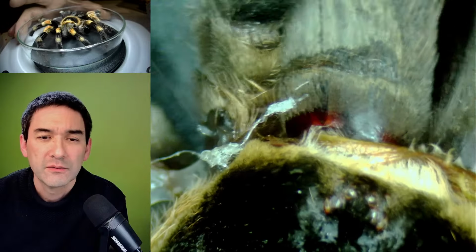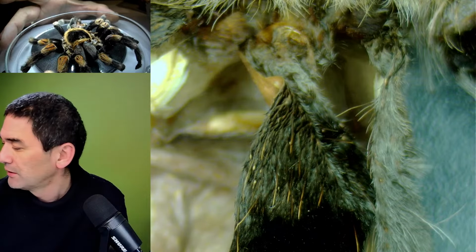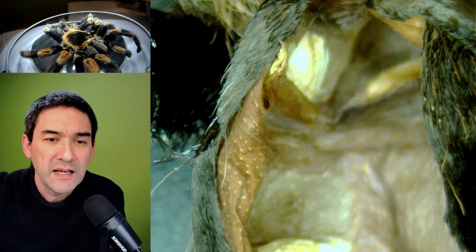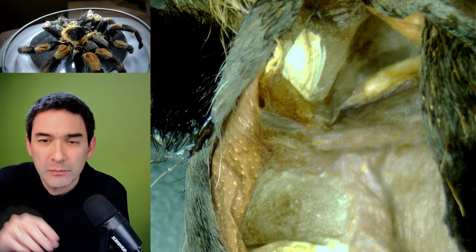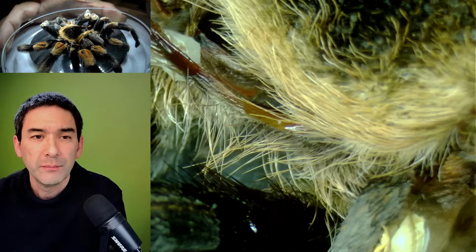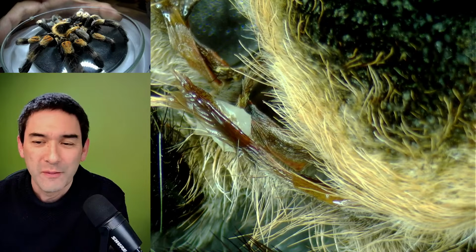Just considering that many of these here actually probably are also sense organs of the spider. Here now on the back, we can actually see this is where it's open, and maybe this is where it emerged, on the back part. The exoskeleton is kind of open, and I suppose that this is where the spider came out when it molted. Considering the fact that this is actually an arthropod, it looks almost like the fur of a mammal or something.